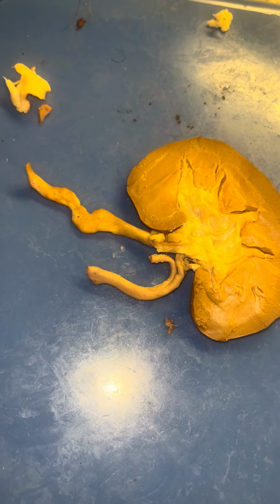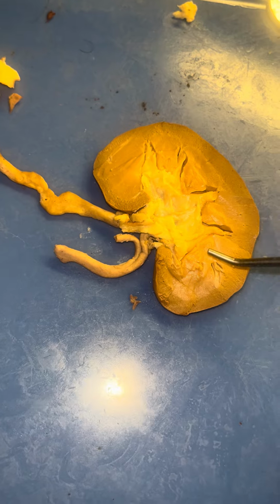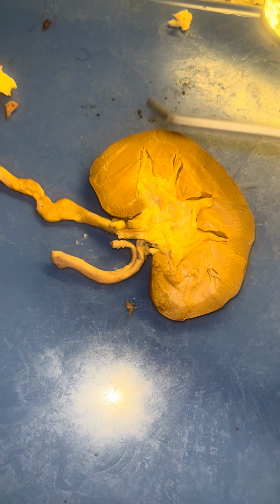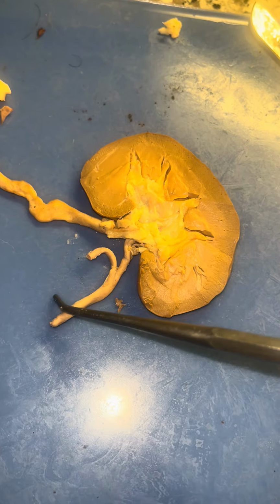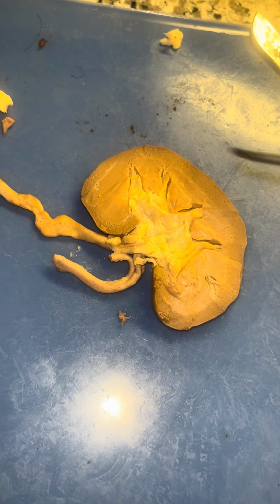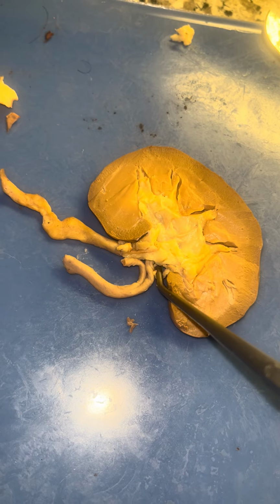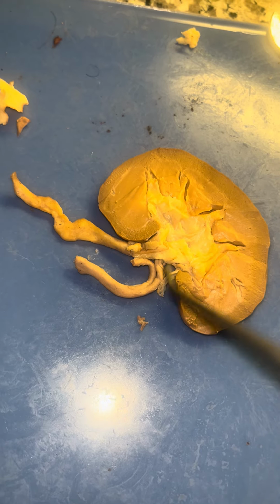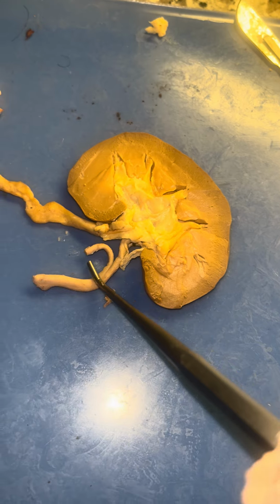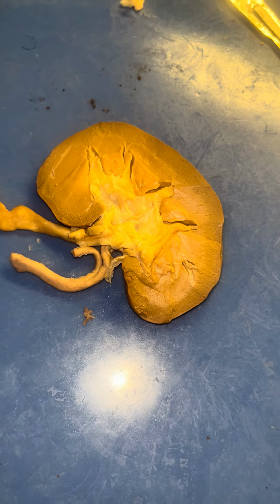The arteries transport blood to the organs, in this case the kidneys, whereas the veins usually are the ones that remove blood from that area. This is only the vein being shown here. I think the artery might have been snipped off in this case, but I think we can see a little bit of the renal capsule right here that's still attached onto the kidney. But yeah, the arteries, and it's difficult to see in here, but that concludes my sheep kidney dissection.